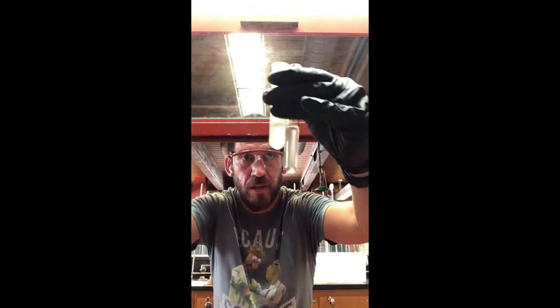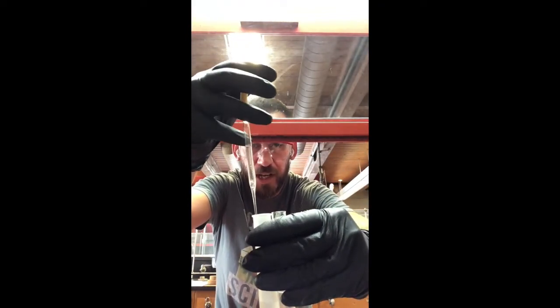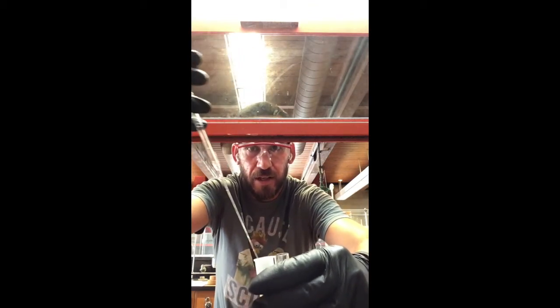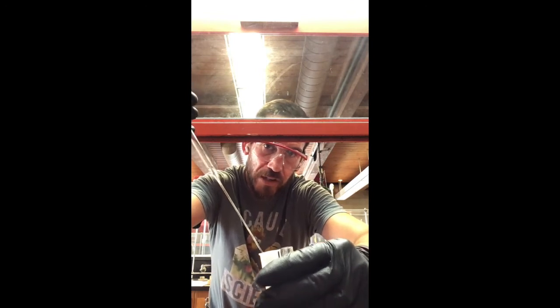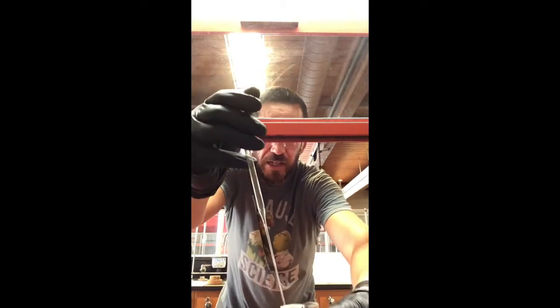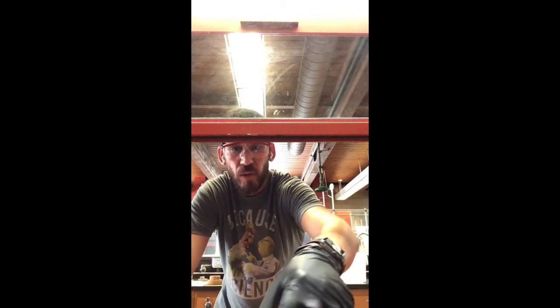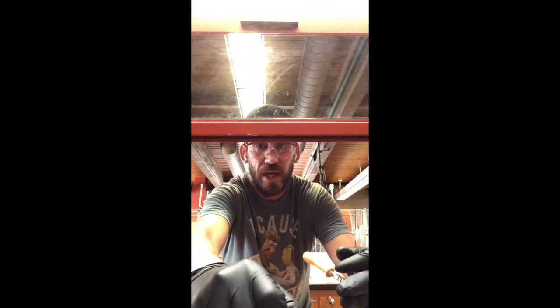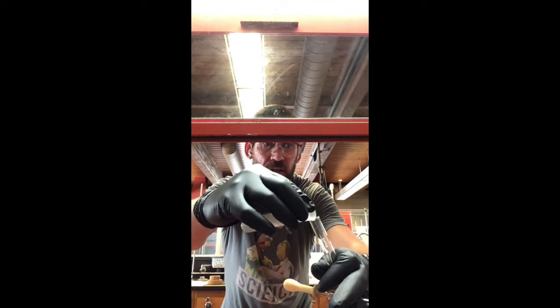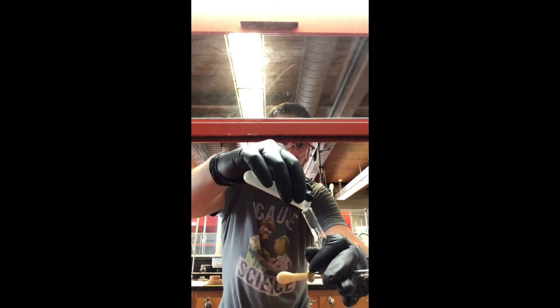So that might have been all of the methylene chloride. The way we can check is to suck that into here. We've got maybe 2 layers. It's hard to tell. Again, it's difficult looking at the 2 layers of water and methylene chloride inside of an opaque tube. So what you can do is transfer, especially on that last one, you want to make sure you get everything. You can carefully pour it into a glass tube, one that's more easily seen through.